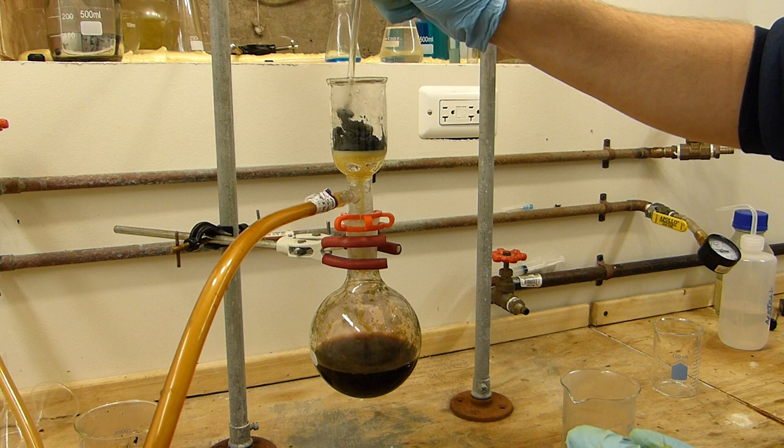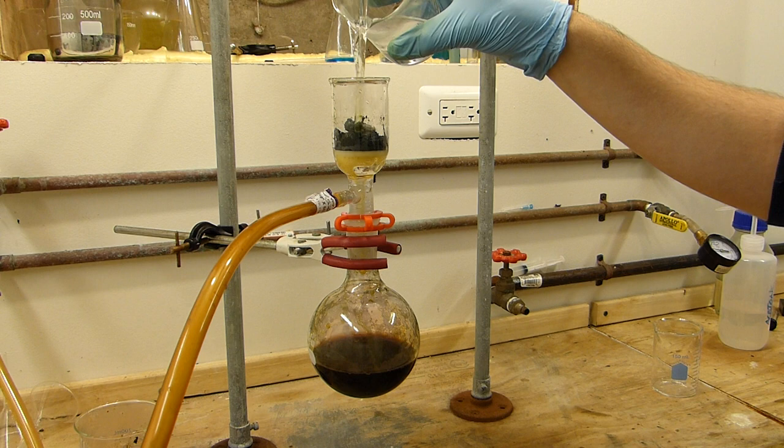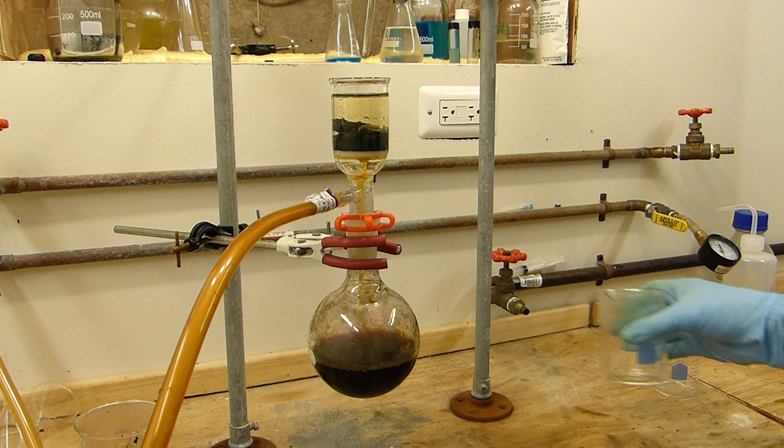So I'll use the stirring rod to distribute this somewhat evenly so we can commence with the washing. And of course you can rinse the stirring rod to clear it of iodine.